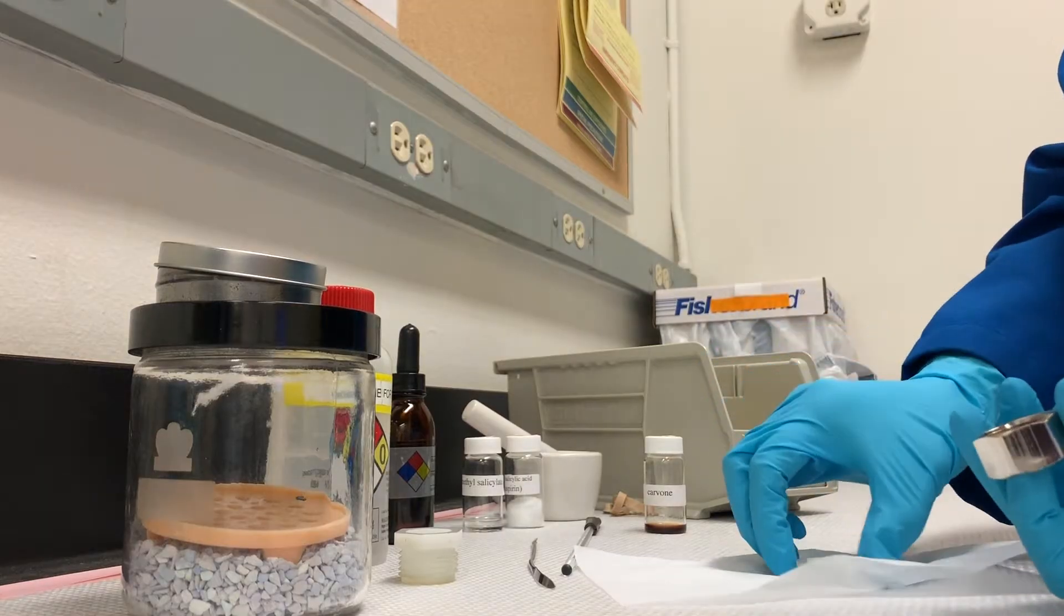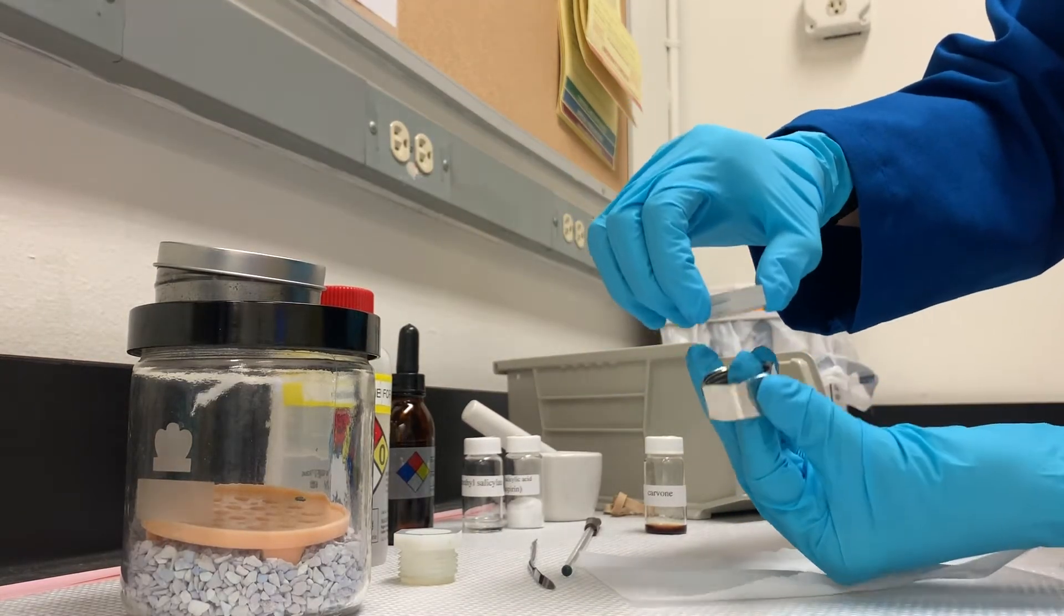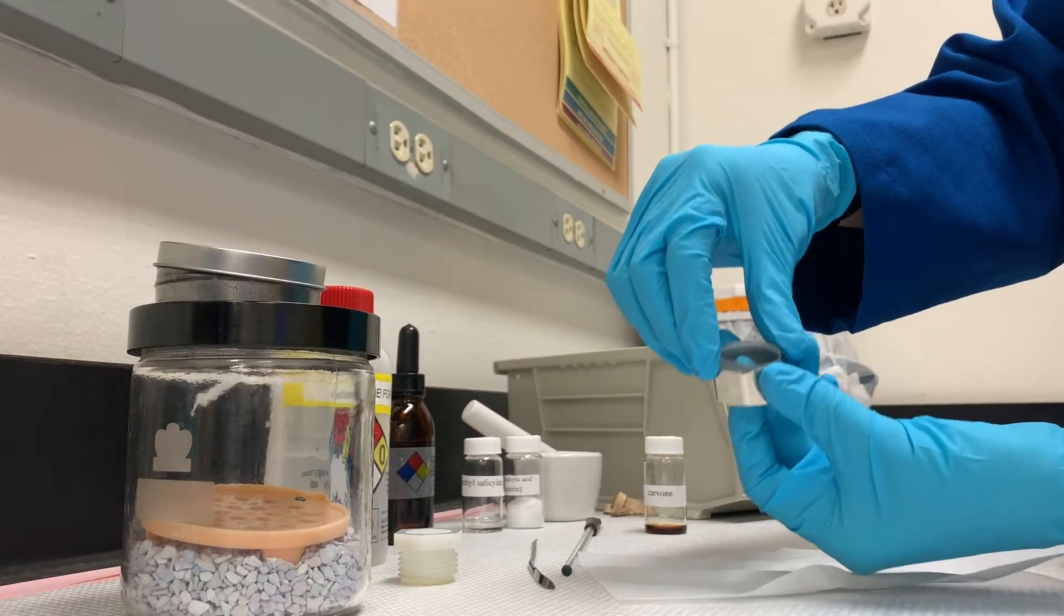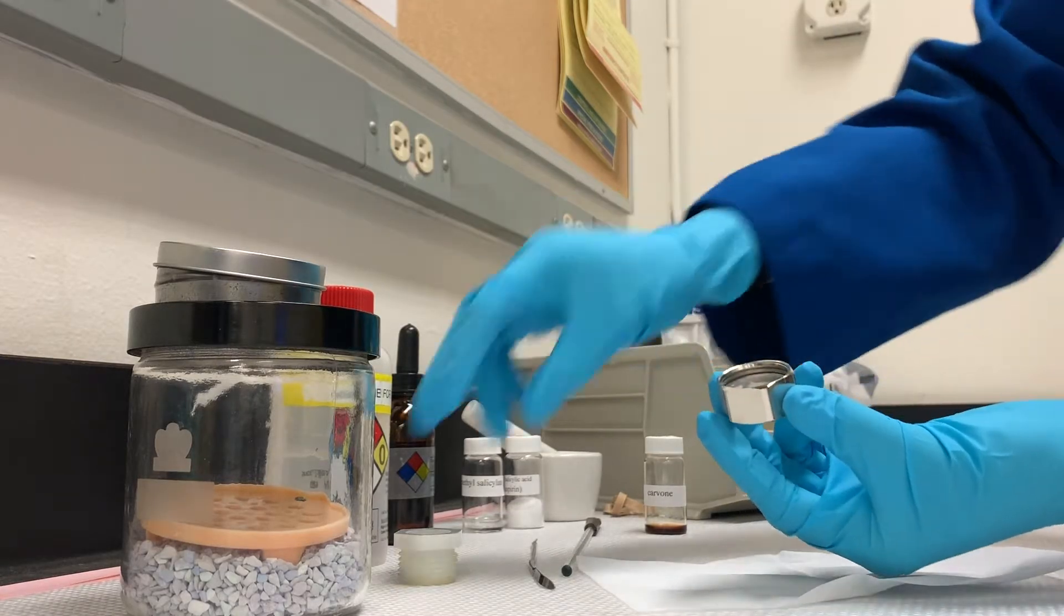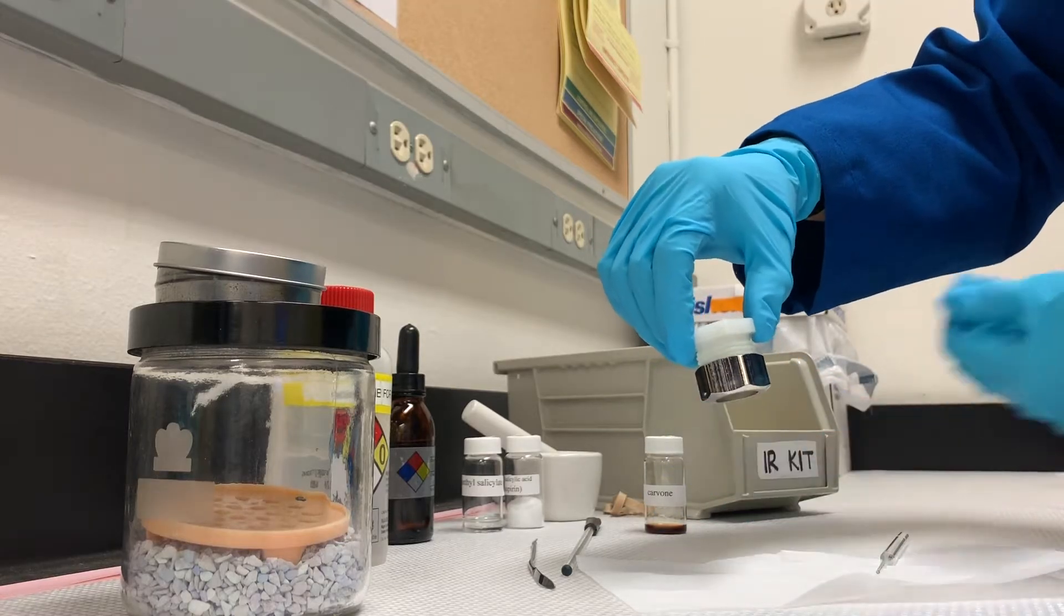We're going to get the plates in the sample holder. I add my finger here so that it doesn't drop in, kind of like eases it in there, and then I'm going to tighten this just enough so it doesn't drop. So that's it.